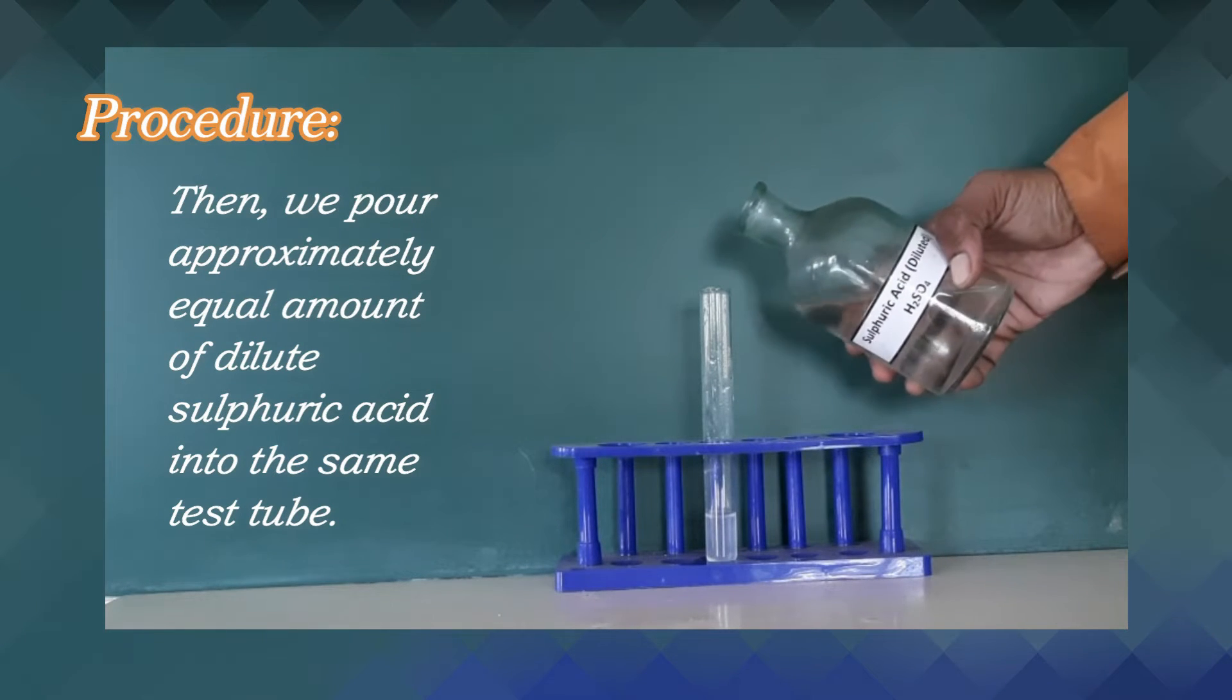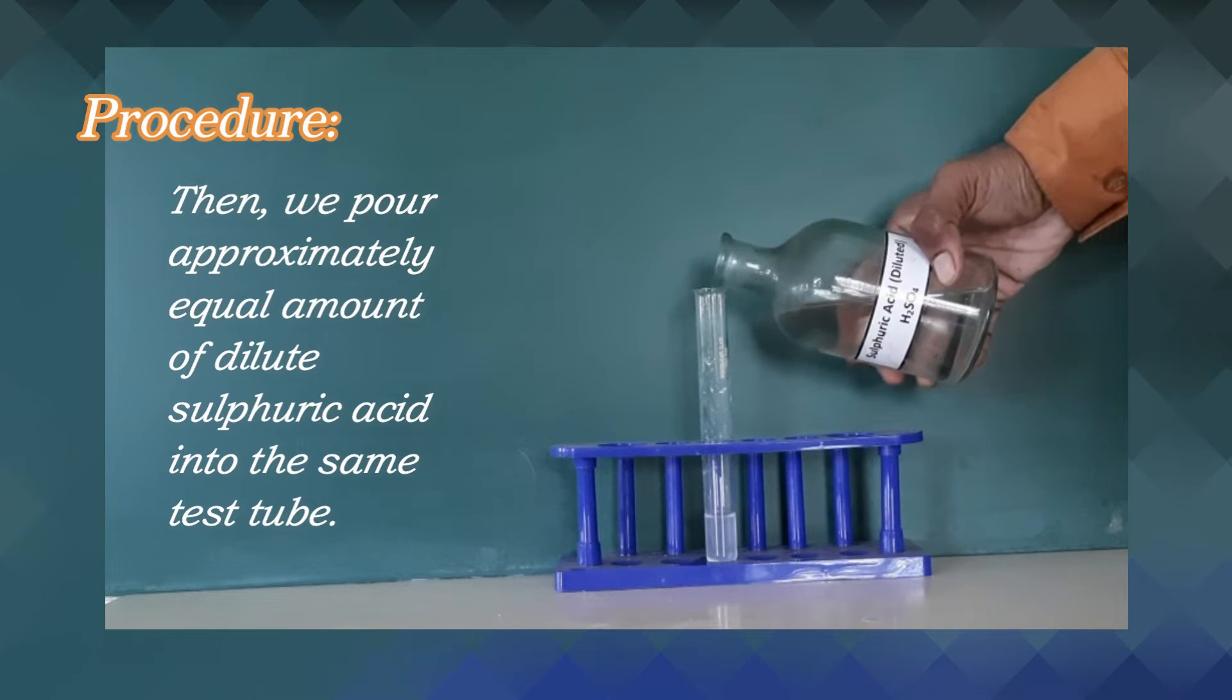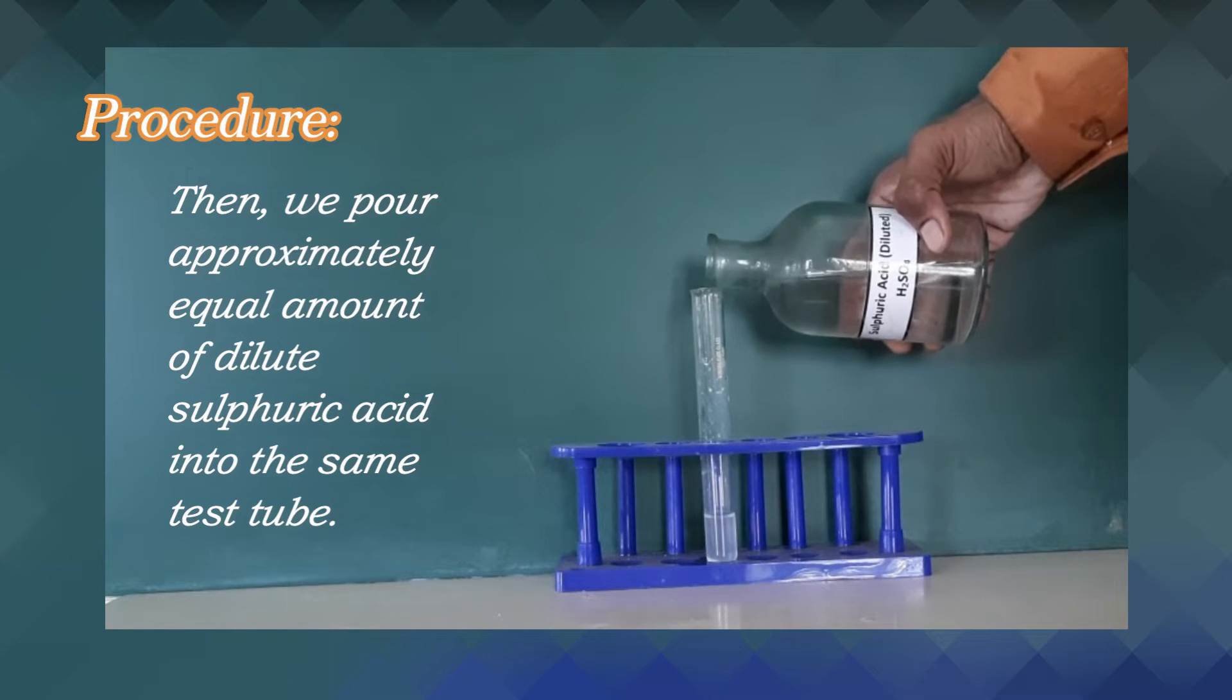Then, we pour approximately equal amount of dilute sulphuric acid into the same test tube.